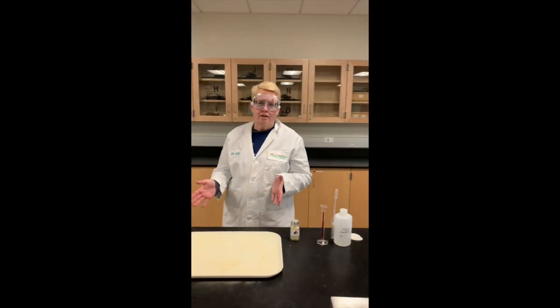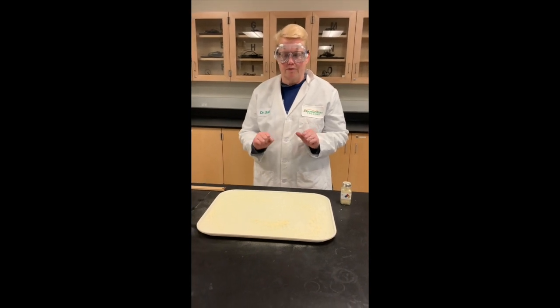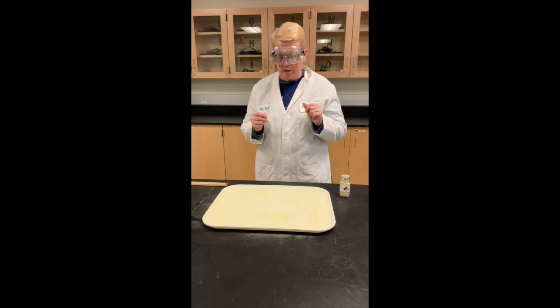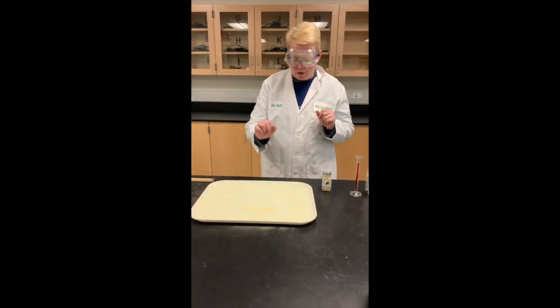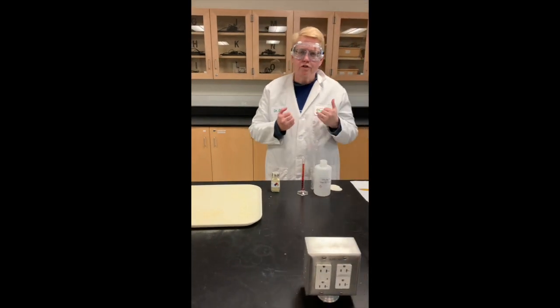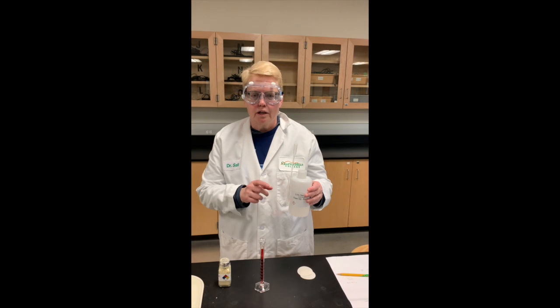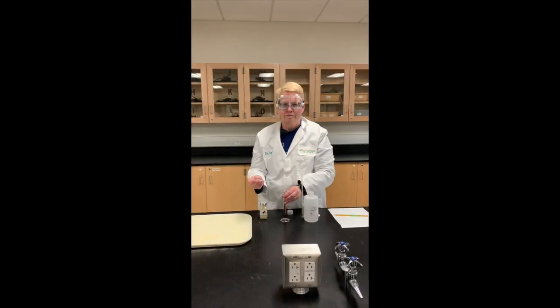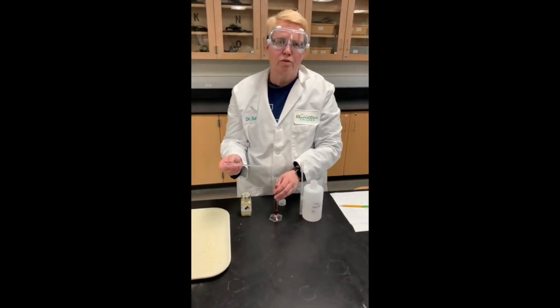So I've already cleaned the wonderful cafeteria tray that we use for this, and I've scrubbed it very, very well, making sure I use water and not touching it with my greasy hands. I went ahead and filled the tray with water, and I'll sprinkle a little more powder on it in a minute. One of the first steps is to figure out how many drops are in a milliliter so that we know the size of one drop. So the first part is to count how many drops there are in a milliliter.